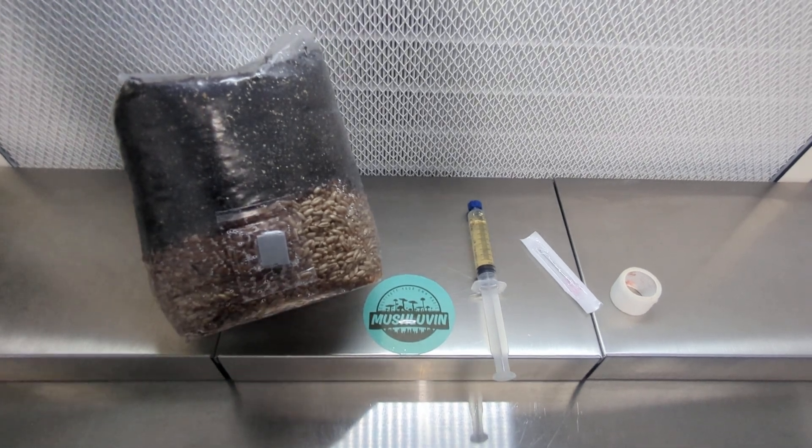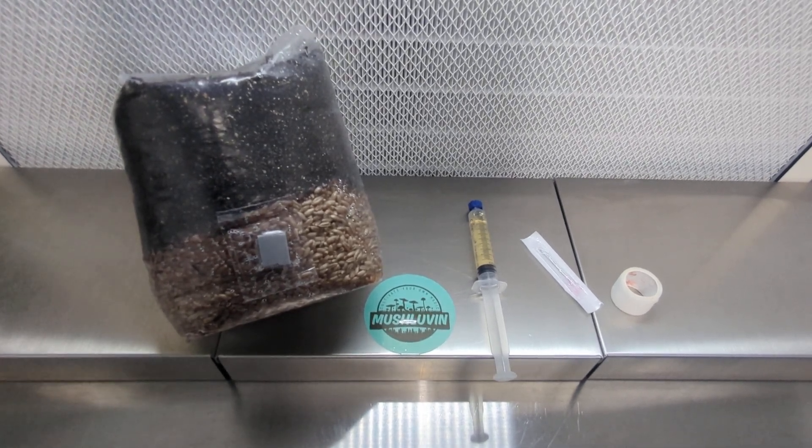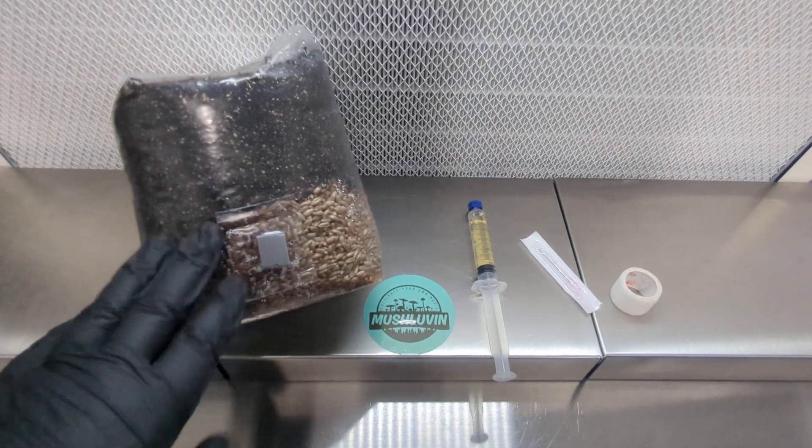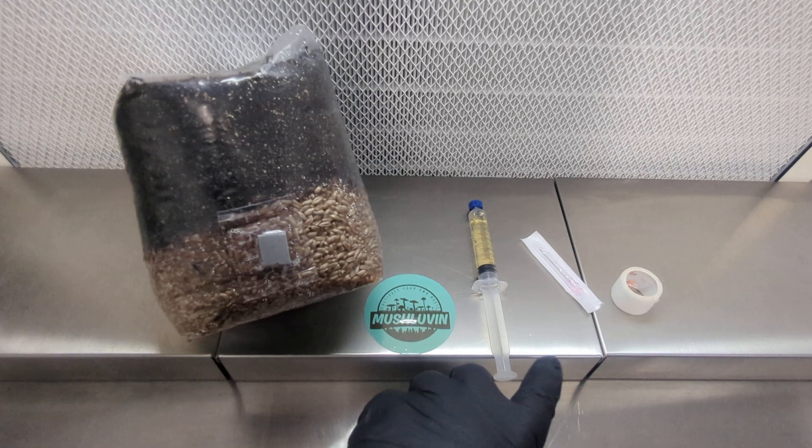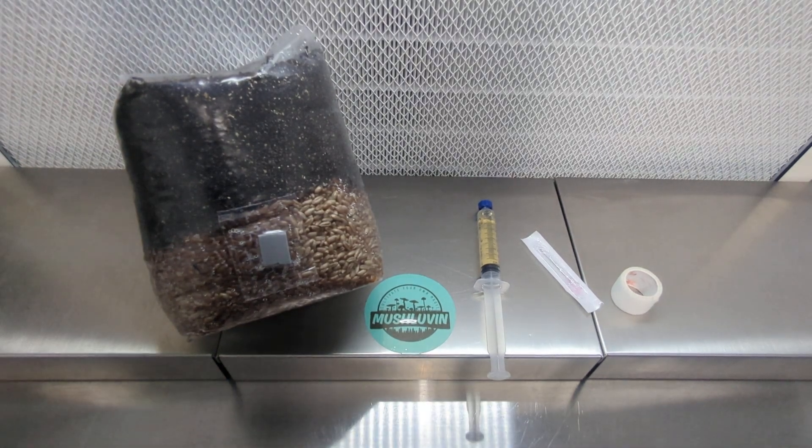Hey Mushman, thanks for joining us. In today's video I'm going to show you how to inoculate an all-in-one mushroom grow bag with a liquid culture syringe. We're going to use a five pound bag which will use five cc's of the liquid culture.